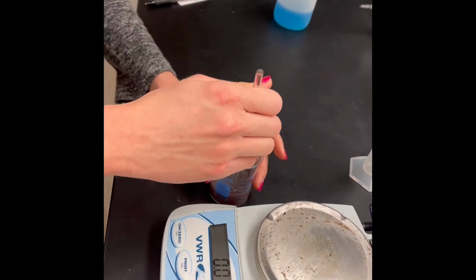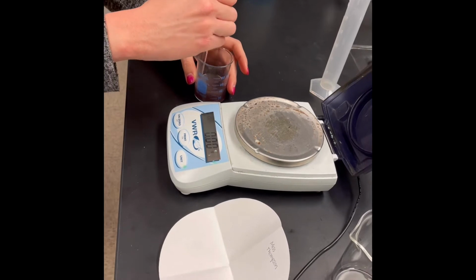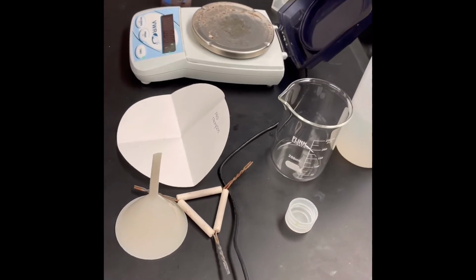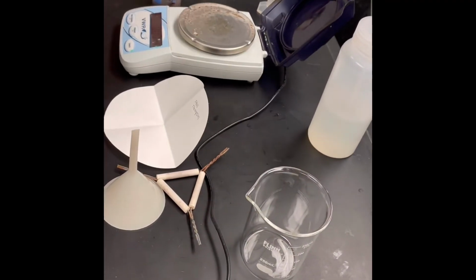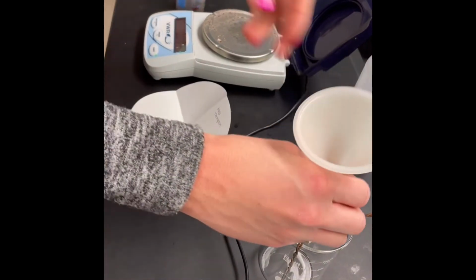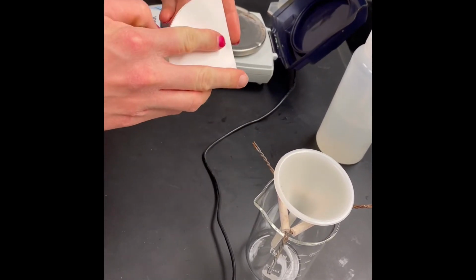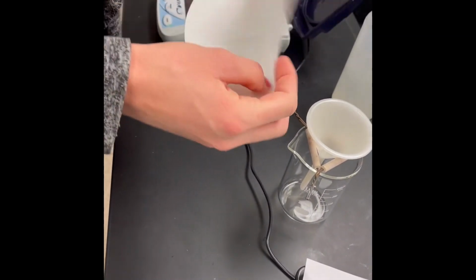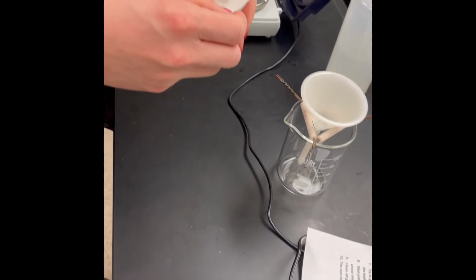Alright, we're going to let the reaction mixture sit and react while we create a setup to filter this solution, because our goal is to separate the copper from the reaction mixture. To set up the filtration equipment, you will need a big beaker and a clay triangle that you place on the big beaker. You put a funnel through it and then you put a filter paper in it. Remember, we already massed our dry filter paper. To put a filter paper in a funnel, you should always fold it in half, fold it in quarters, and then open one flap so it makes a nice cone, and then you place it in your funnel.